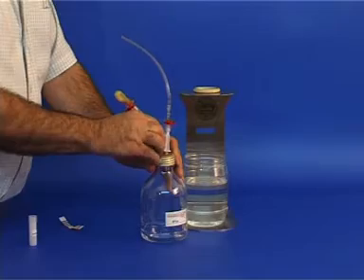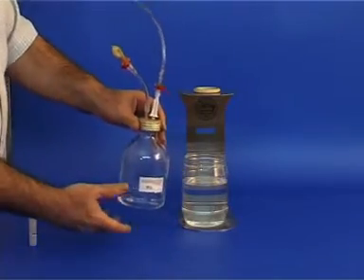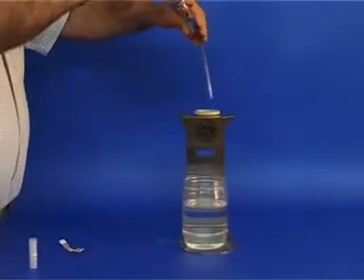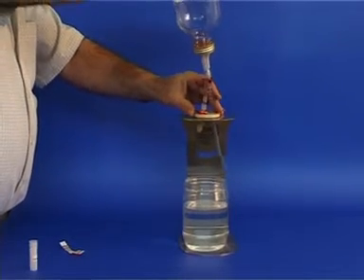Next, insert the syringe needle into the rubber stopper and turn the bottle upside down through the ring so that the tubing is inserted into the water and touches the bottom of the container.